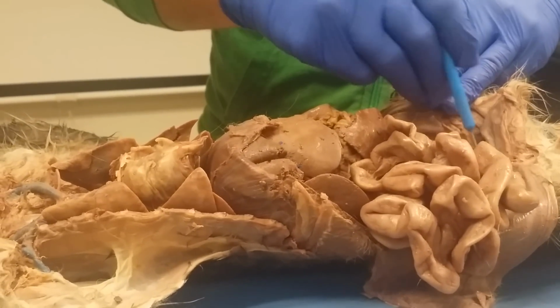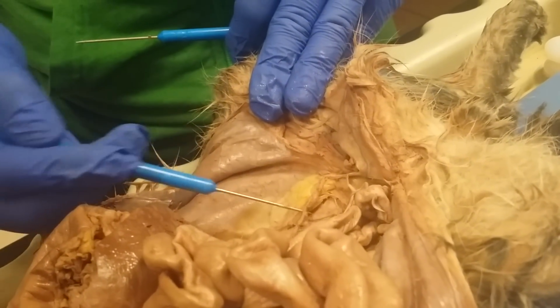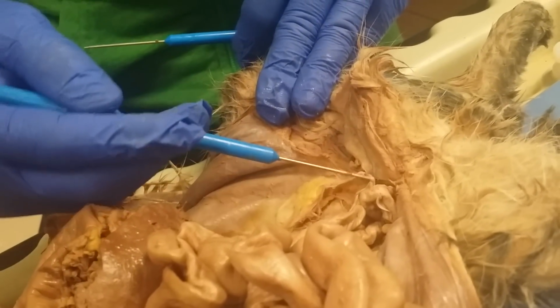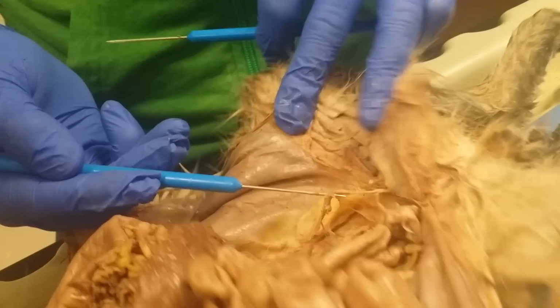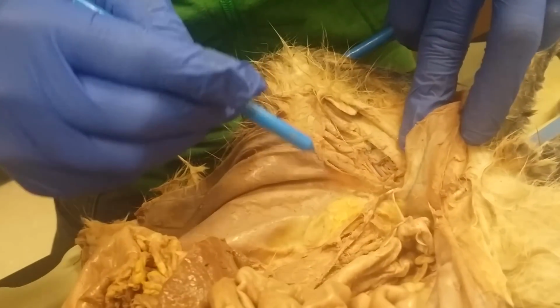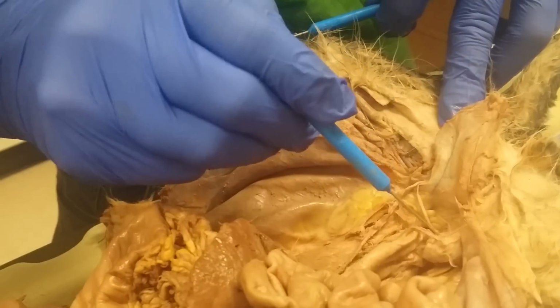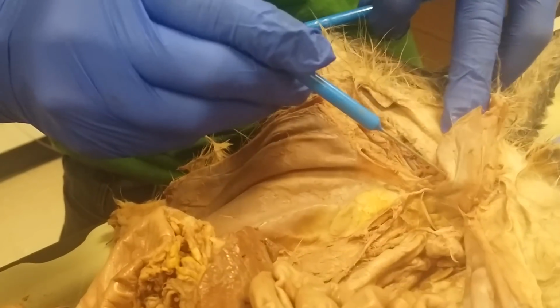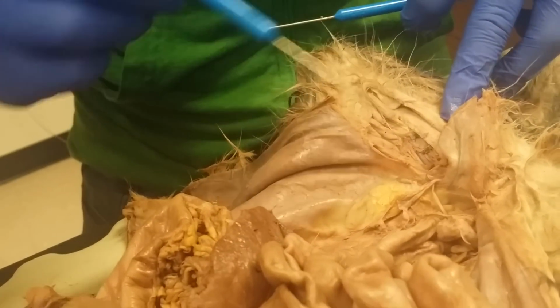And if you can find the testicular artery or vein, make sure you know those two. That's kind of hard to find. I think this actually might be a testicular artery right here. If it doesn't go to the bladder. Here's the bladder. Urethra will go that way. I think so. I think this is probably a testicular artery. Yep. I think that's about it. About it for a cat?